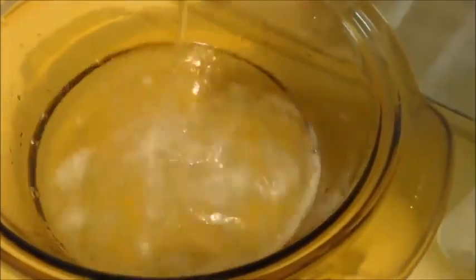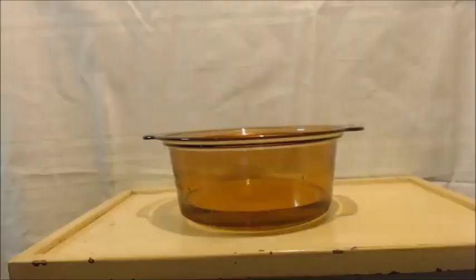Wow, this is starting to think there's sulfuric acid in here, man. It is still going strong. I barely have any stuff left to throw in here. I'm just guessing, but the first time I threw in, I started out with a pH of 2. The first time I threw in about 20 grams, which is half of what I had, and the pH went up to a 5. I threw in another 10 grams, so that's 3/4 of what I had, and now the pH is up to about a 7.